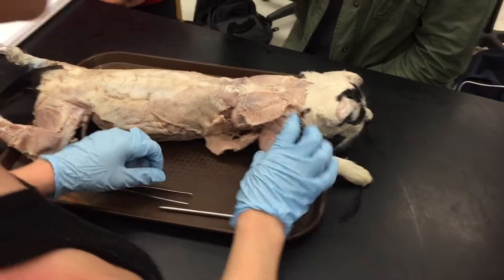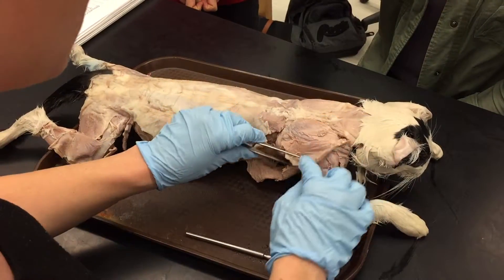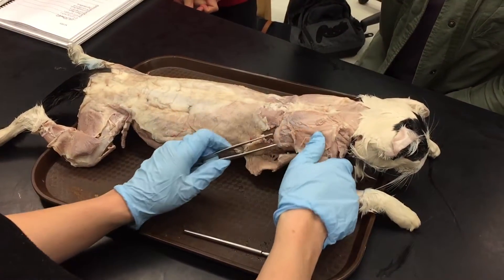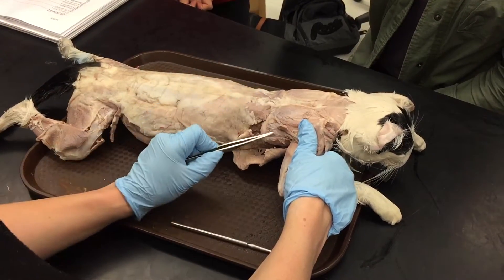What we're going to do this week is the supraspinatus. So underneath — does anyone remember what this was? Underneath the trapezius, when we reflect it back, we have the supraspinatus. This top portion here, and then the infraspinatus is the bottom portion. So you can see there's a thin separation — supraspinatus, infraspinatus.